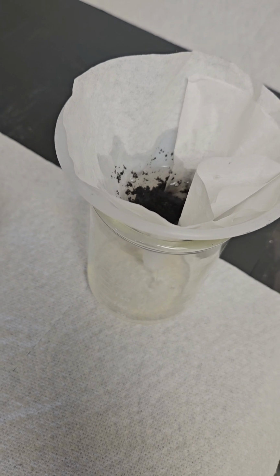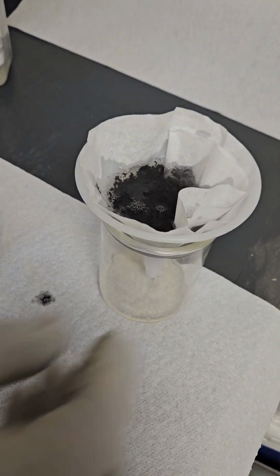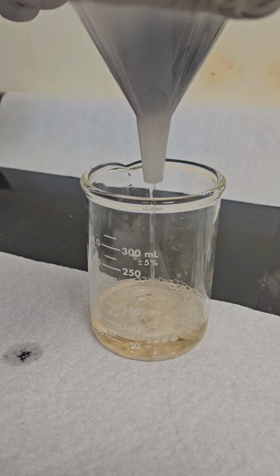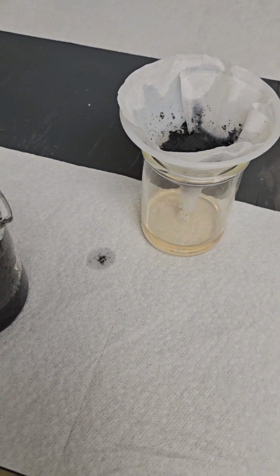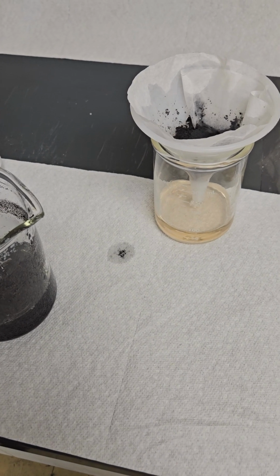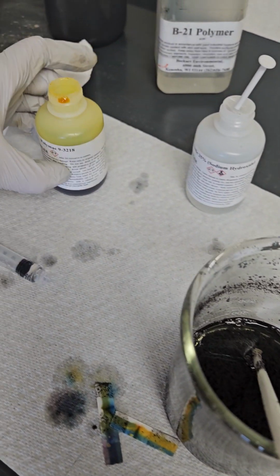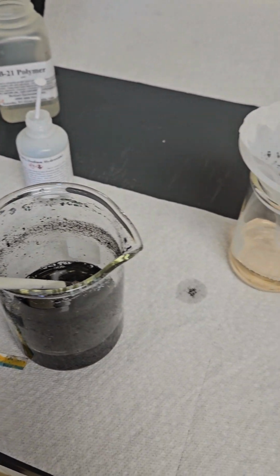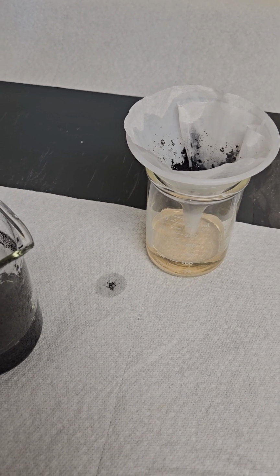All right. So, see, we got a nice filter. So it's not too bad a dosage, about 3 gallons per 1,000 on this particular sample of the Polymac 93218, and maybe 0.1 of caustic, maybe 0.15 per 250.